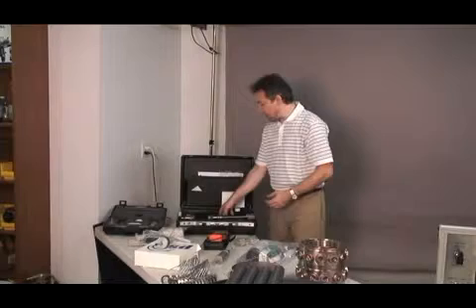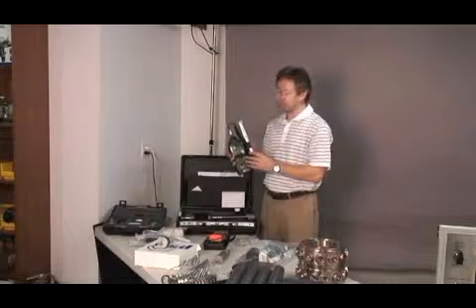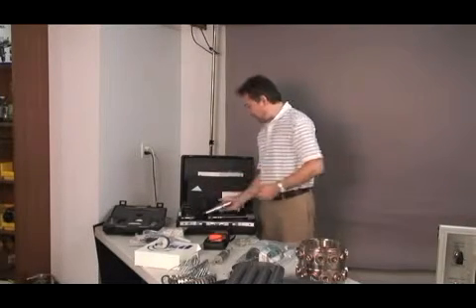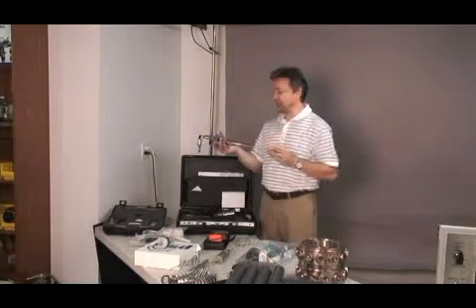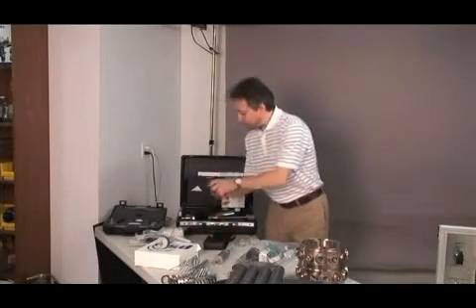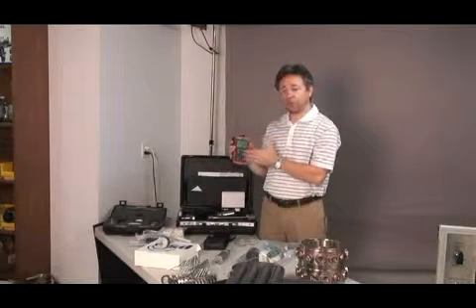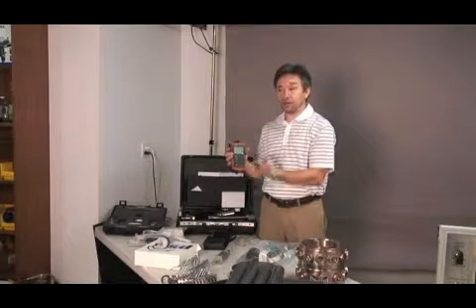And also you are going to do real-time measurements of concentration from the nose port through this optical aerosol monitor, which is equipped with a specially designed sampling assembly. The temperature humidity meter will enable you to not just take real-time readings of temperature and humidity, but also to download the data in the computer for validation.